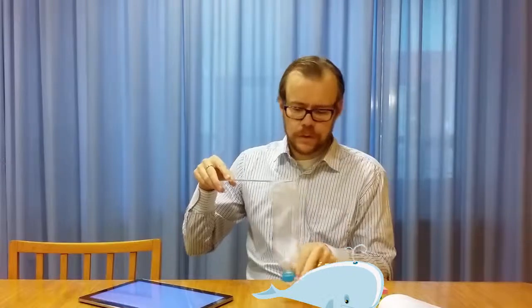And that you can discover if you check in the backwards scan image, because when you scan backwards, you will have the same effect, but the reversed case. So here you will see some sharp edges, and then you will see some smooth slide downhill here. So if you have in forward direction a smooth slide on this side, and in a backward direction you have a smooth contour on this side, then you know that you haven't set the regulating parameters correctly. Alright, that was a little bit about atomic force microscopy.